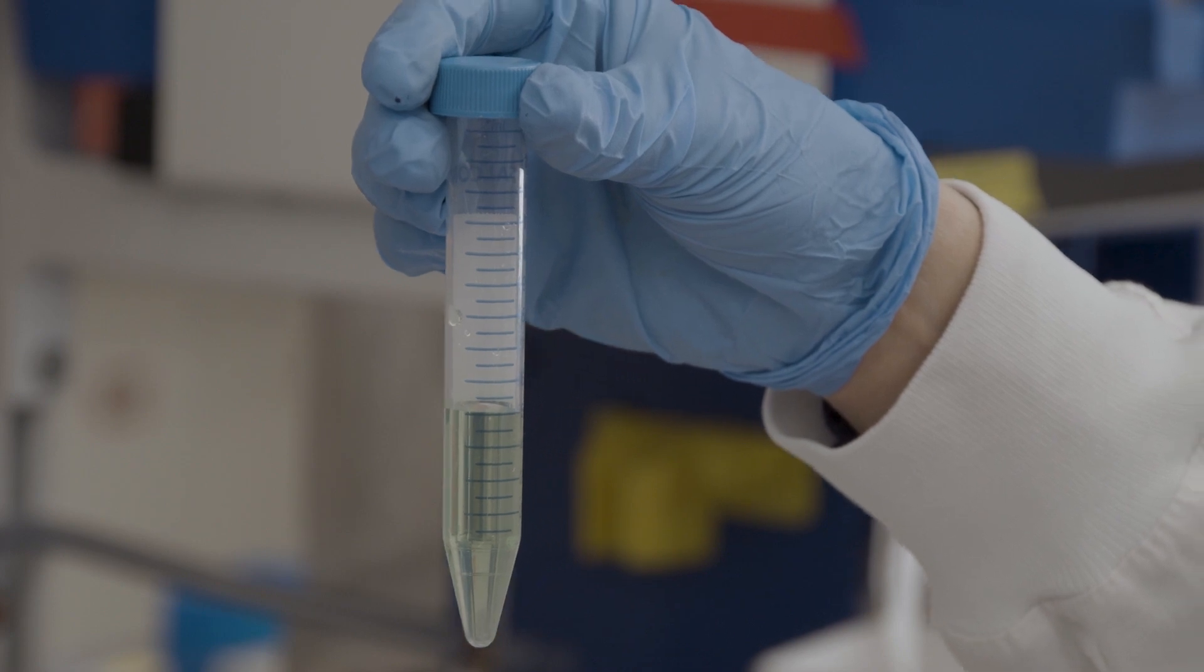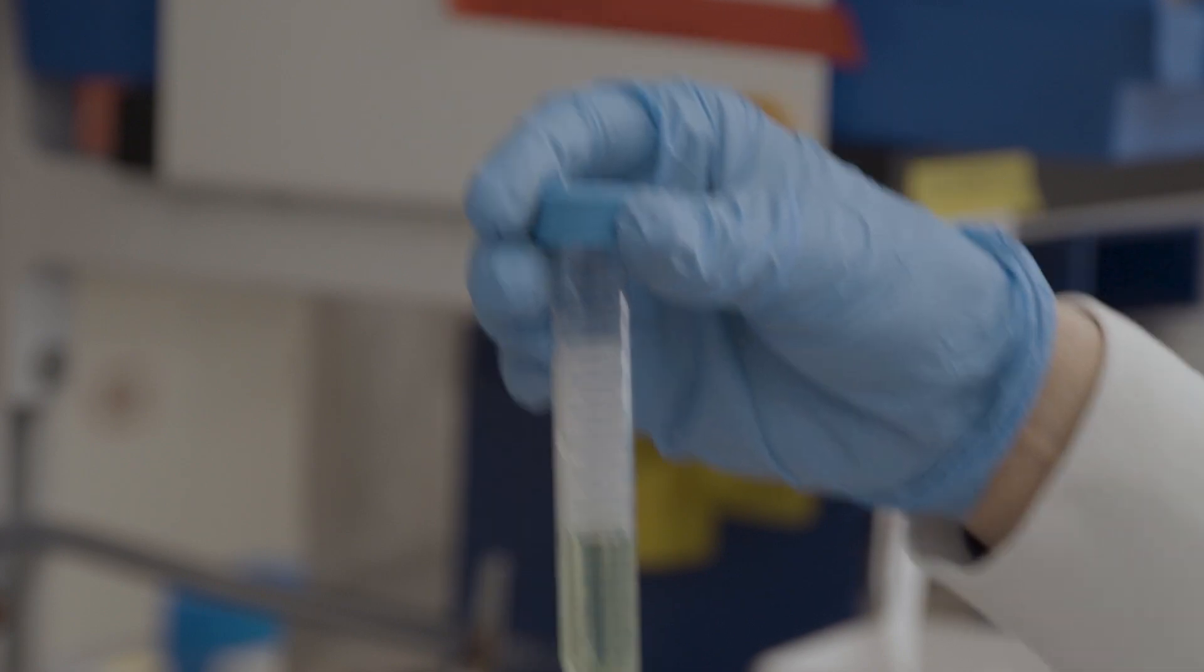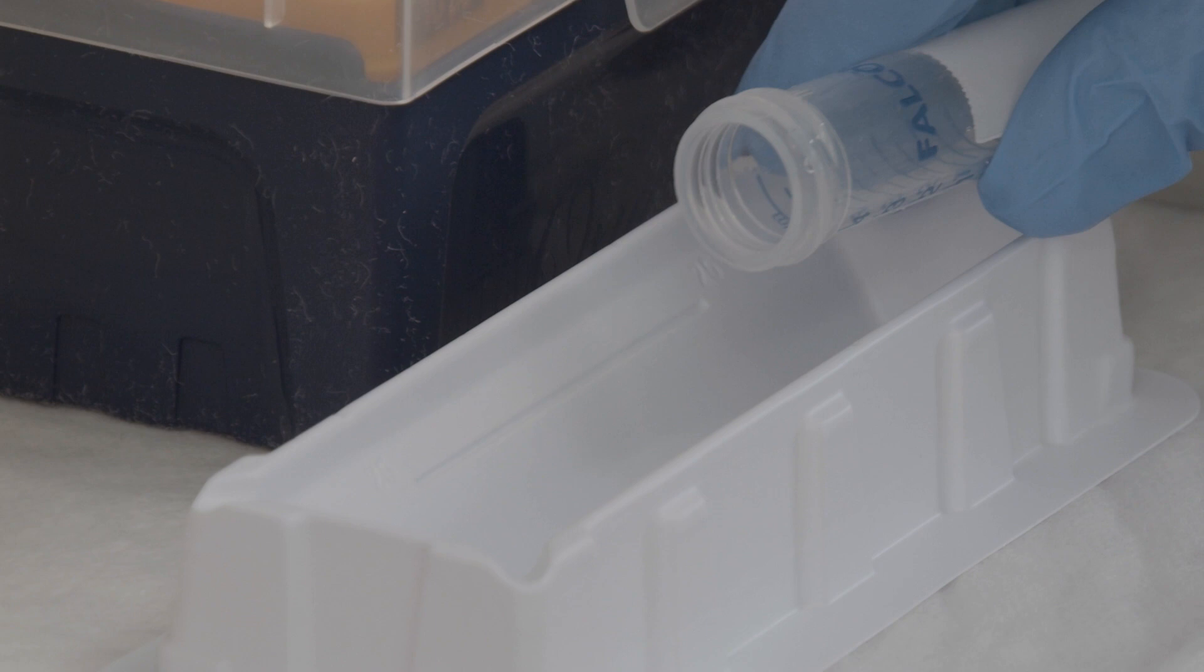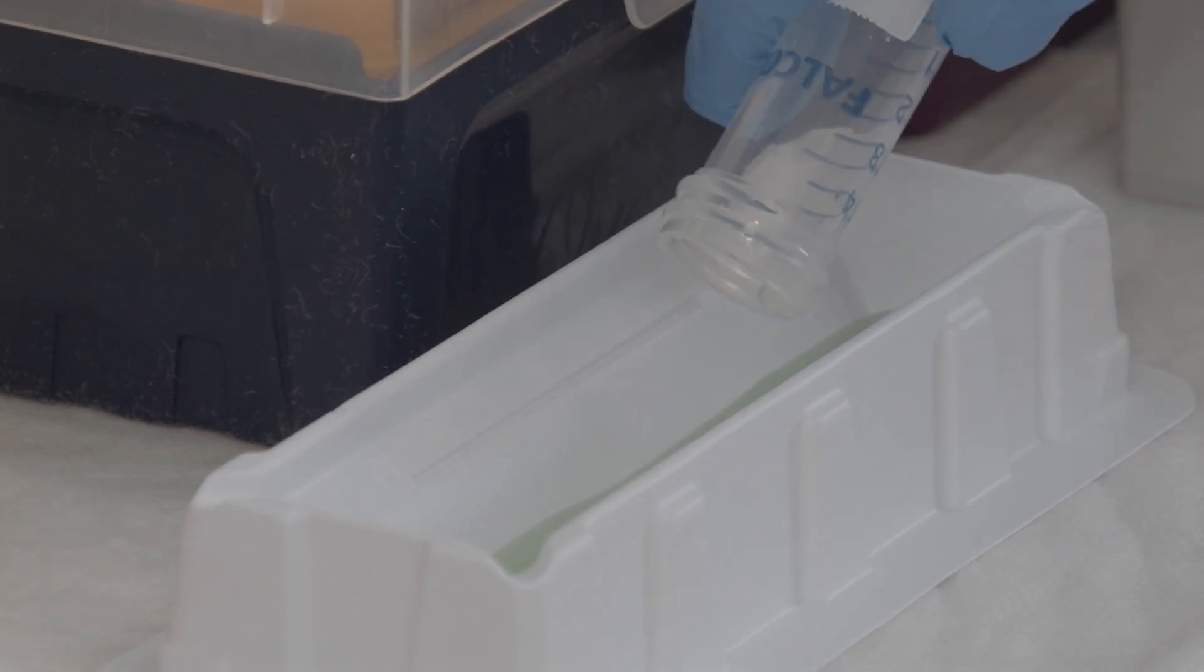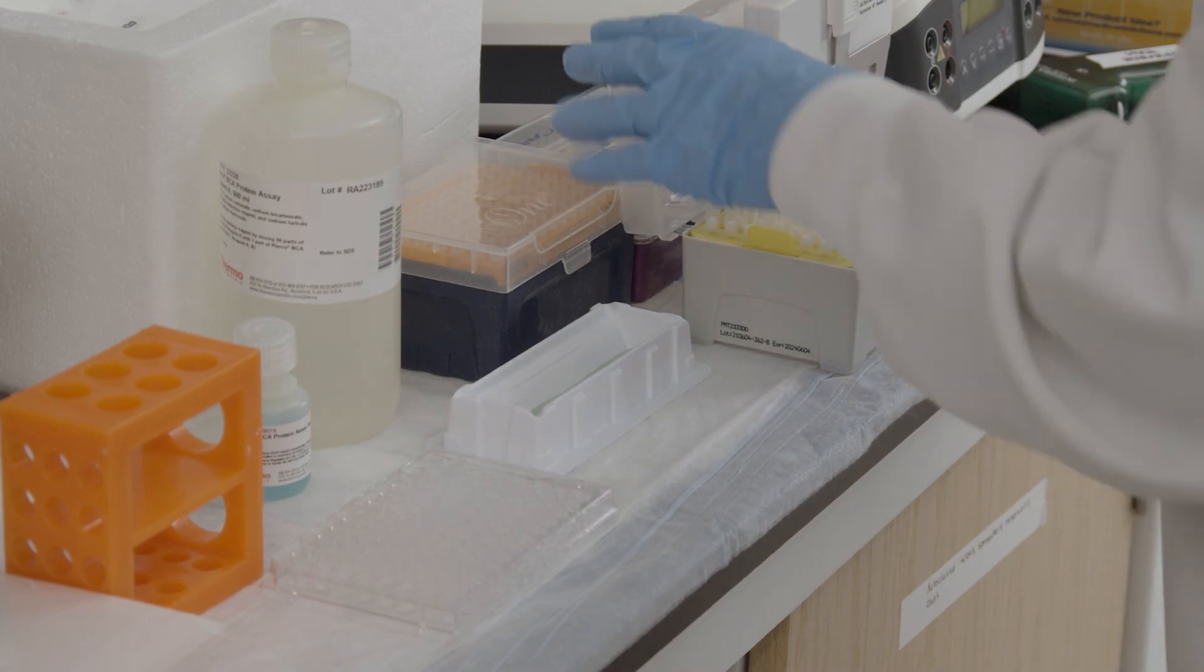Next, you'll need to determine the protein concentration of the sample. There are many protein quantification kits available. Most use a bovine serum albumin reference to determine the sample's concentration relative to the BSA standard curve. Just follow the kit directions and you'll be fine.